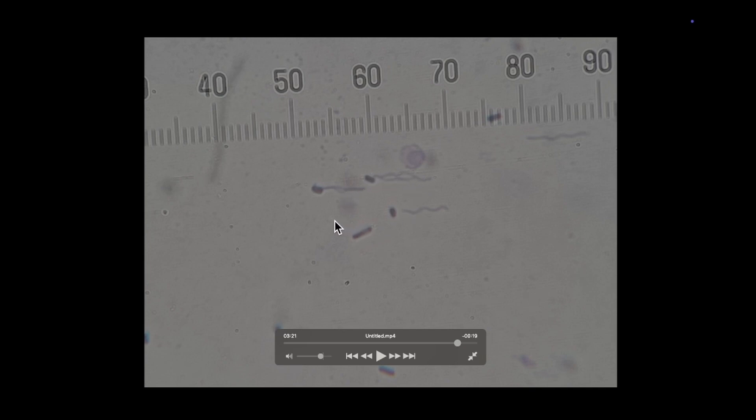This Ryu stain is easy to prepare and the success rate of flagella staining is relatively high compared to other methods.